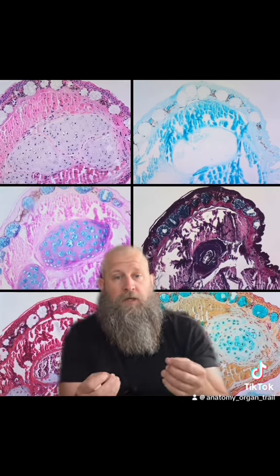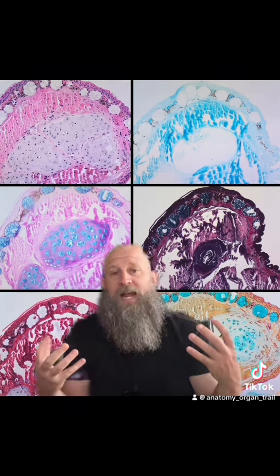So depending on what it is that I want to look for or what I might be trying to highlight, I might pick a different stain. And depending on the stain combinations that I use, I can get an overall idea of not only the structure of the components that I'm looking at, but I can get an idea of the chemical composition as well. And that can help me overall describe the anatomy of the tissue and understand better what might be happening inside of these tissues.